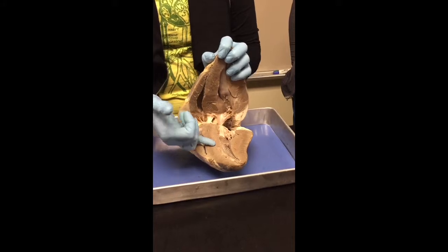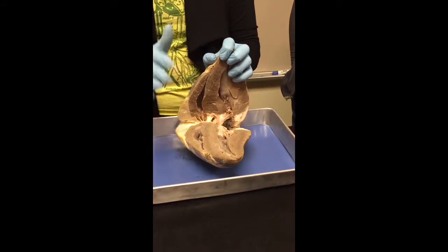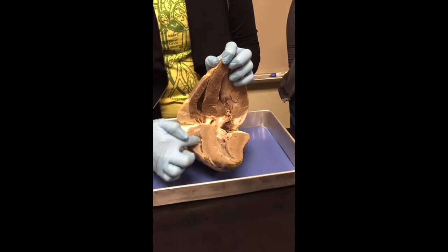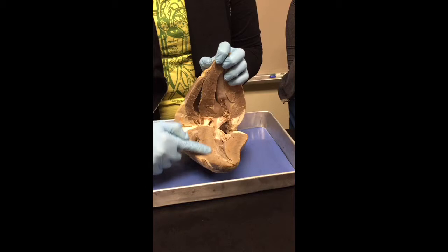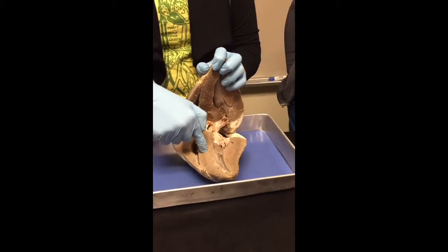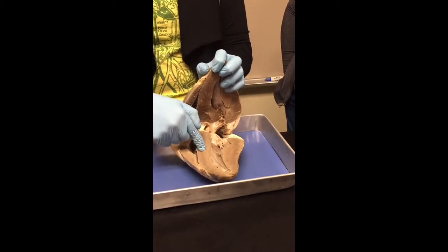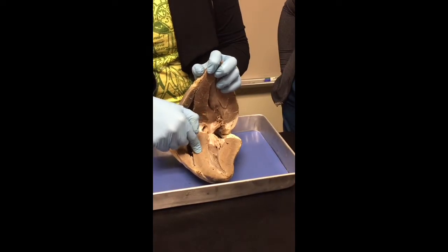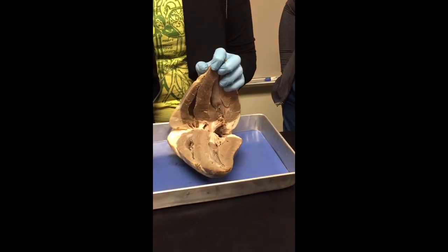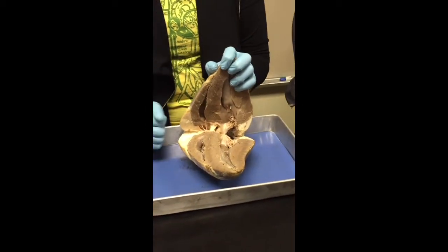What is this tissue called? Myocardium, okay? This is also called the interventricular septum because inter meaning between, ventricular because it's in between the two ventricles. So this is also called the interventricular septum. So if I ask, what is this specific structure, you would say interventricular septum. If I say, what is this specific type of tissue, you would say myocardium. Does that make sense? Okay, so I'll have a note card with a question next to it that lets you know what it is that I'm looking for.